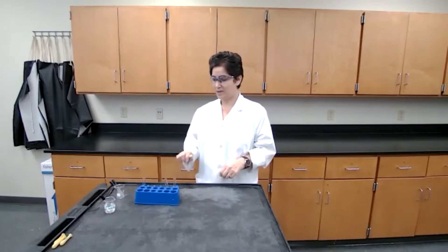Hi, I am Dr. Namari and I'm going to perform the experiment for chloride groups, which is the qualitative analysis for cations.